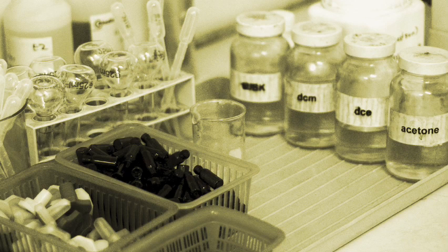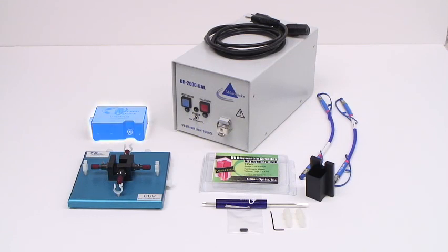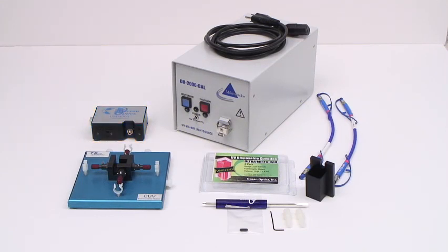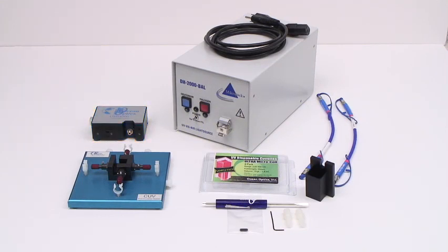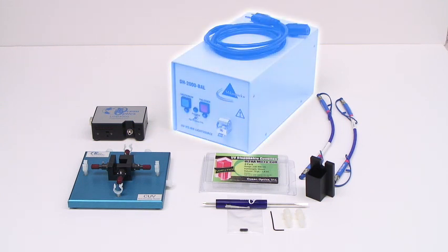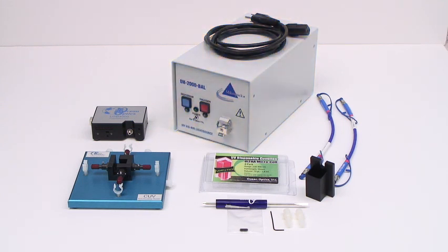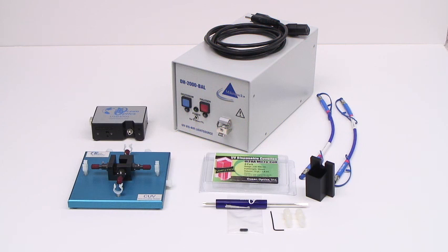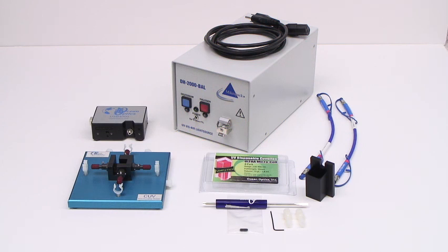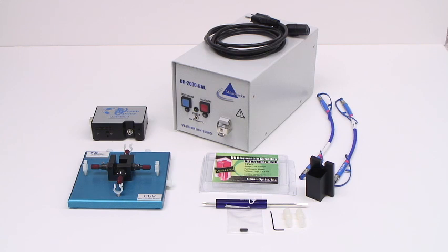Here's the equipment we'll use: a USB 4000 UV-Vis spectrometer from OceanOptics. Our light source is the DH2000BAL. It combines the output of deuterium and tungsten halogen sources in a single optical path from 215 to 2000 nm.